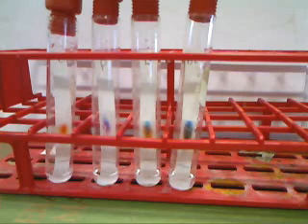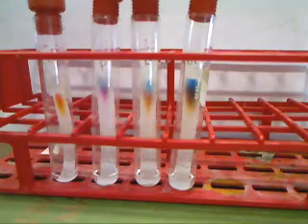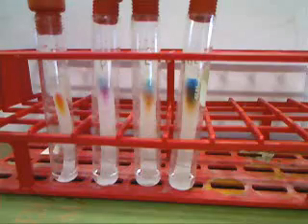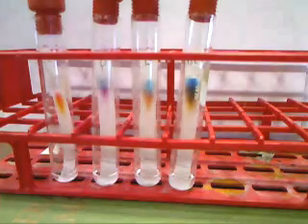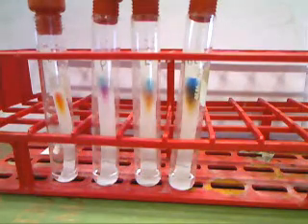The experiment has been running for several minutes, and you can see that the water is moving up the column and that the dots of ink have begun to spread out as they go up the line. They're not nearly to the top yet, so we're going to have to keep going from here, but things are going along. As you can see, the solvent has made it almost to the top of the filter paper, so the time has come to take the strips out and measure how far the different parts have moved.